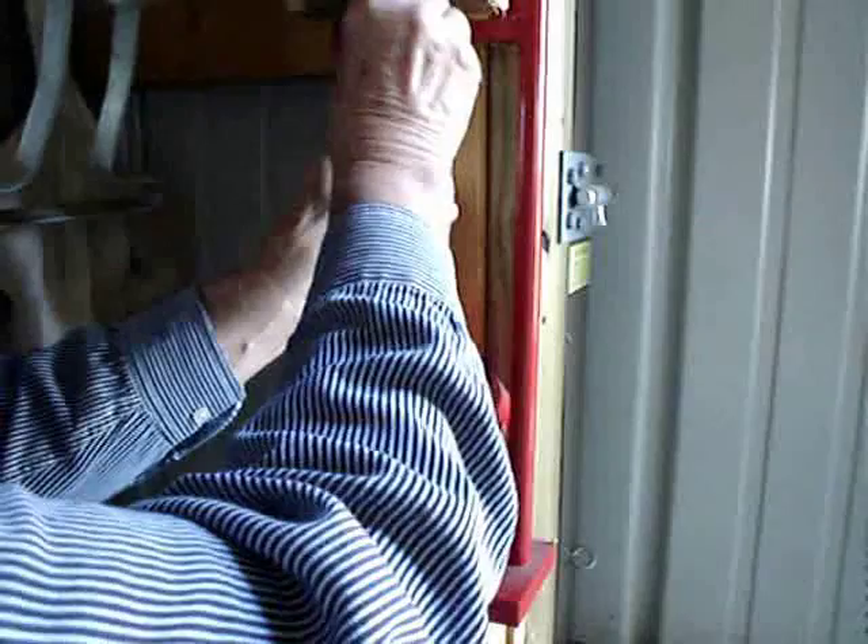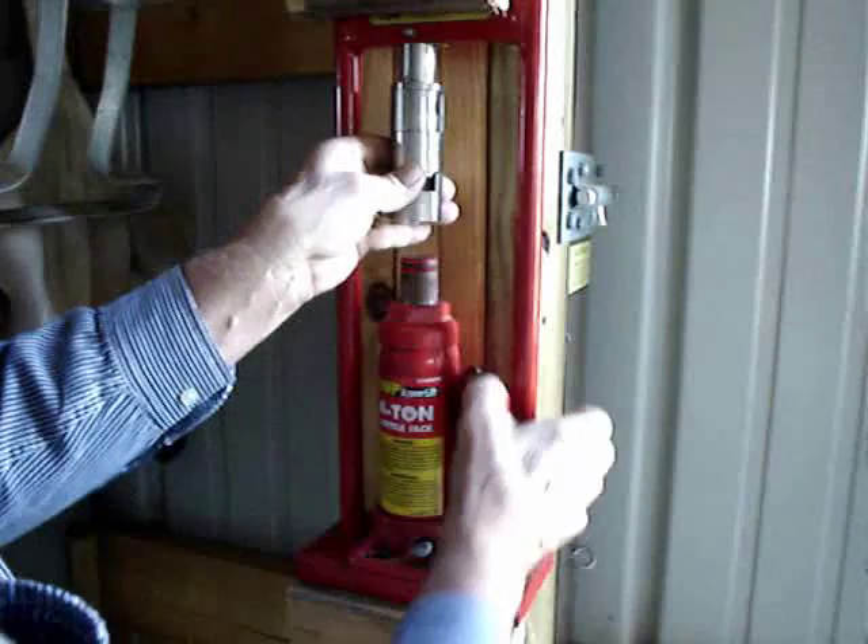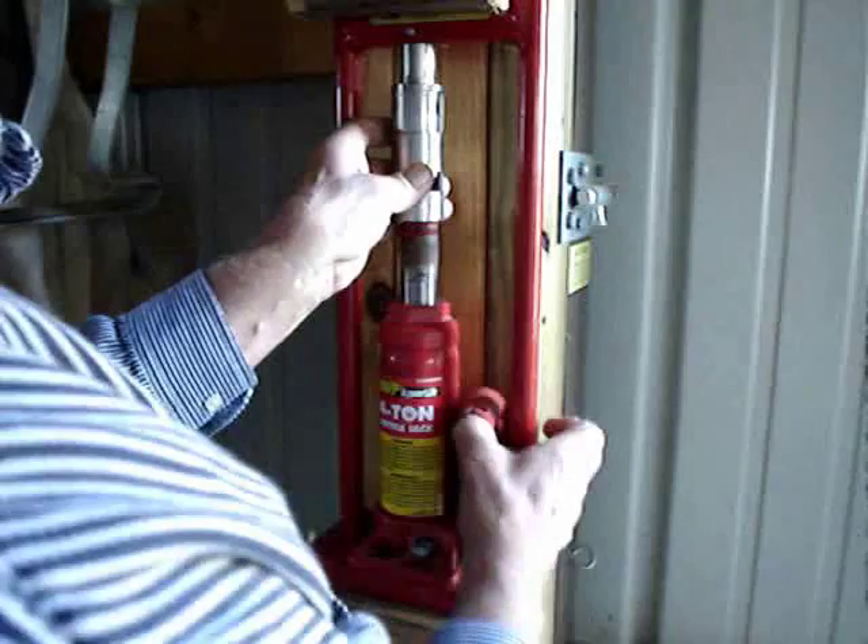Now this sits on here so we've got quite a stage, and we're going to lift it up because gravity will pull all this apart if we're not real careful. Some people, by the way, don't put this retaining pin in because they quickly know what they're doing. Raise your hydraulic press until it firms.